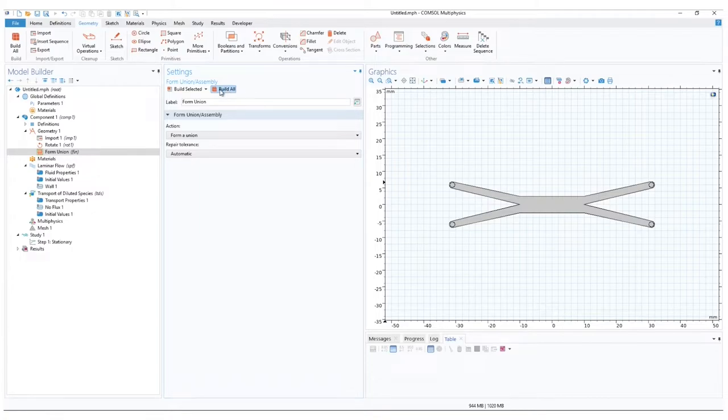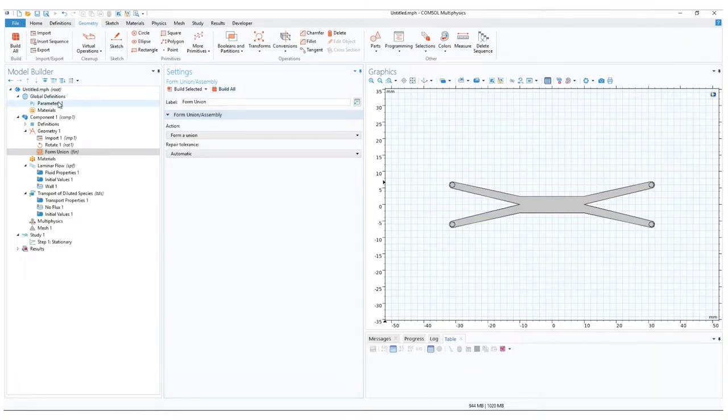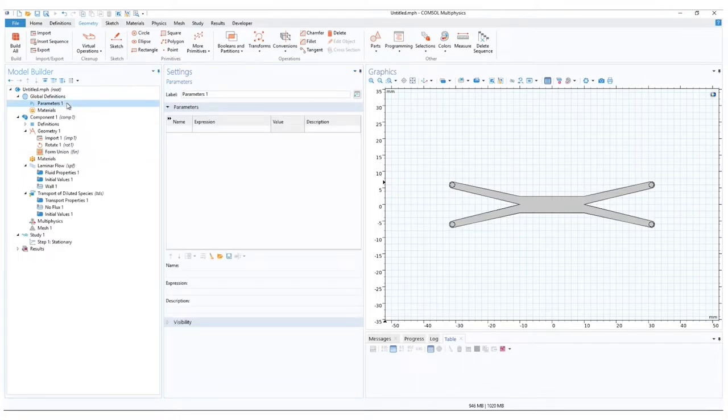To define our flow rate and chemical concentration, on Model Builder ribbon under Global Definitions, click on Parameter 1. And here we will add our global variables. Double click to add. For the flow rate, let's name it Vin. Press Tab to move to the next box. For the flow rate, let us add 3 milliliters per minute. It is important to specify all units to avoid conversion errors in COMSOL.